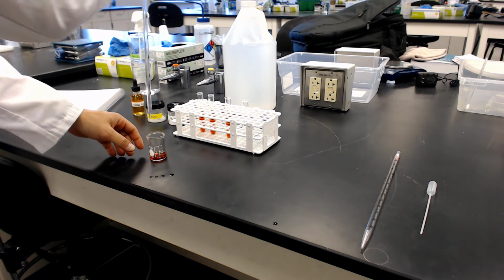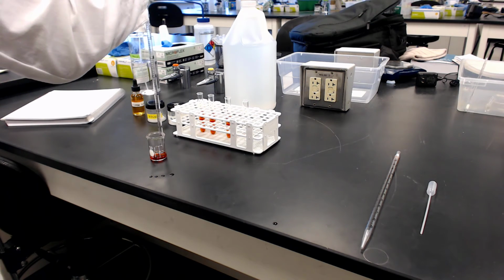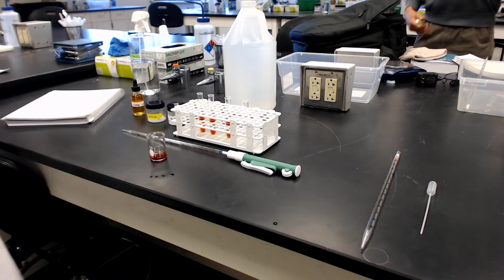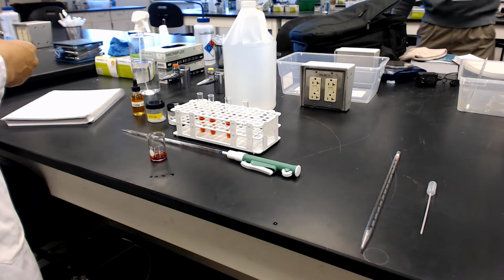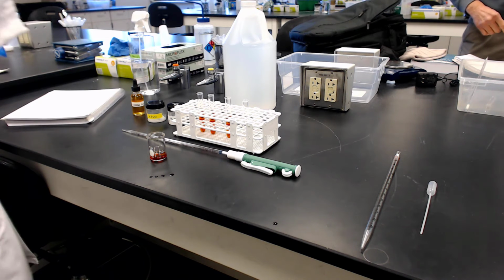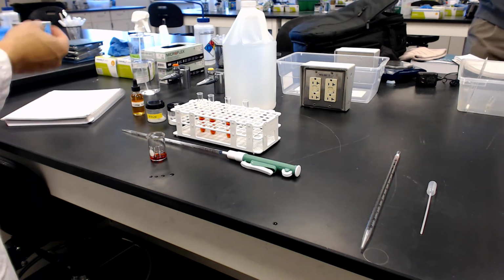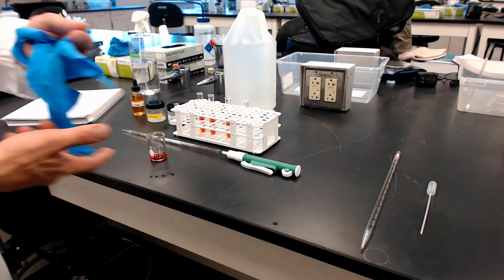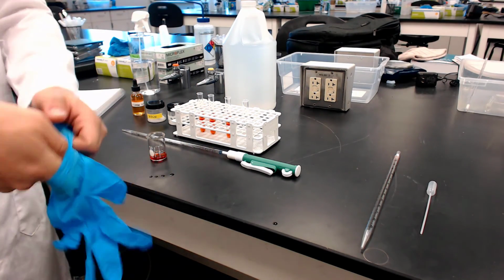All right. So building the last tube. Pipette. It looks like Dr. Thompson. There I am in 2 places at once, talking to him for a minute. Oh, and there you go. Dr. Thompson's saying, hey, you better put your gloves on. Here we go.